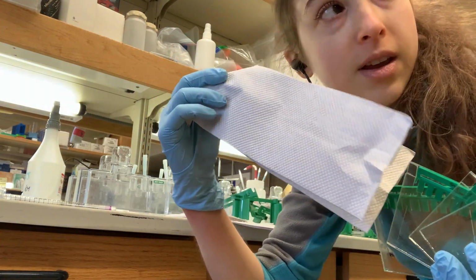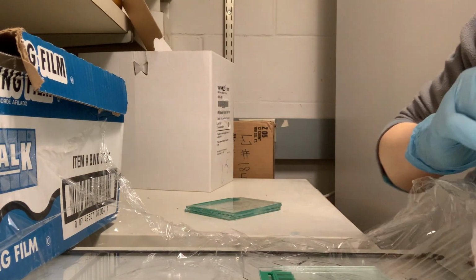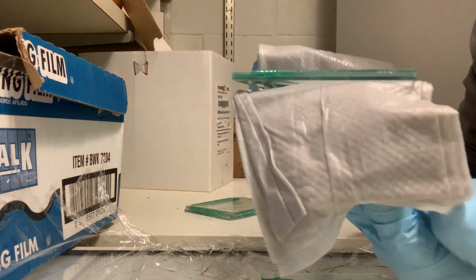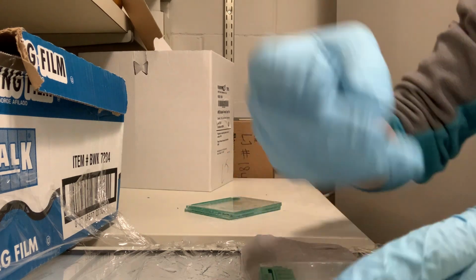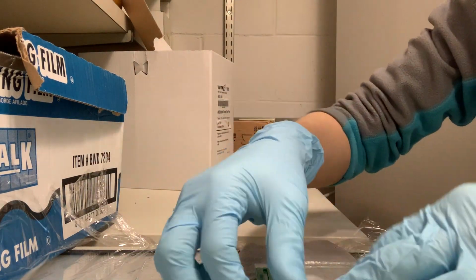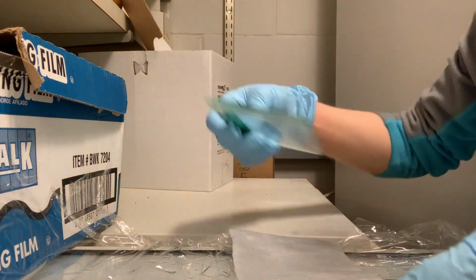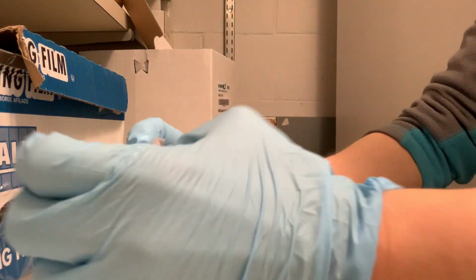I'm going to take some trifold paper towels, which are really great for this, and get these wet, and then wrap them around the gels. I do stacks of 2, so that you don't have to unwrap them too much and then potentially have the rest dry out. So I just fold and flip and flip. The trifold ones seem to be a nice height for this. Okay, so now I just need to wrap up the stacks.